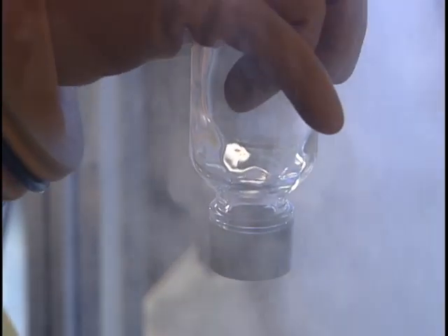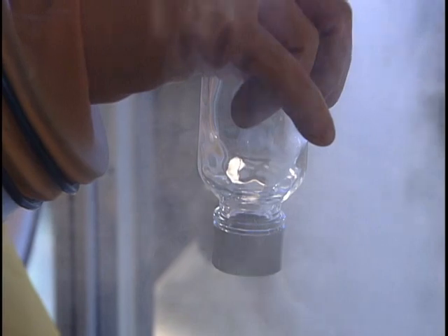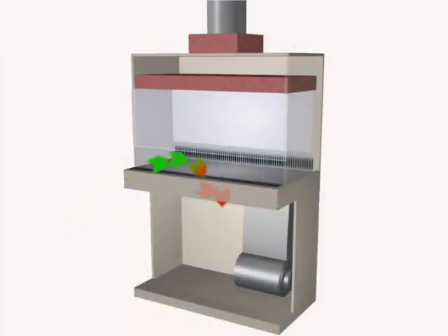As you probably suspect, vertical airflow workbenches have a vertical flow of filtered air. Unlike the horizontal airflow workbench, in vertical airflow workbenches, HEPA filtered air emerges from the top and passes downward through the work area. The critical principle of using airflow workbenches is that nothing should interrupt the flow of air between the HEPA filter and the component being used for the preparation of compounded sterile preparations. All materials placed within the compounding work area disturb the pattern flow of air blowing from the HEPA filter. To maintain sterility, nothing should pass behind a sterile object in a horizontal airflow workbench or above a sterile object in a vertical airflow workbench.